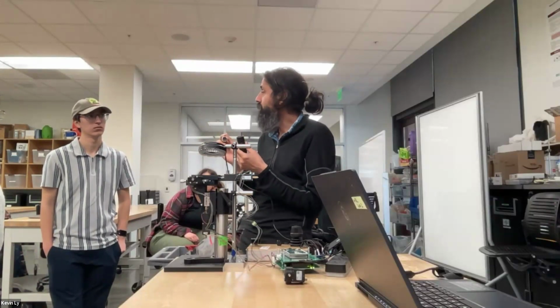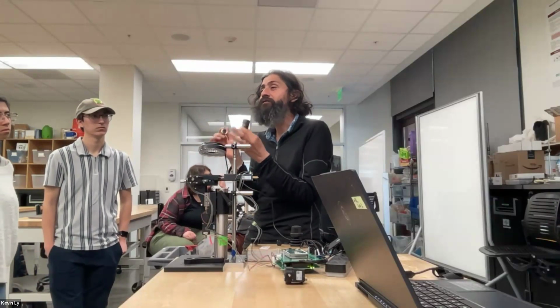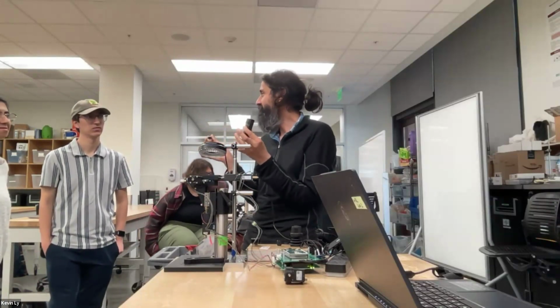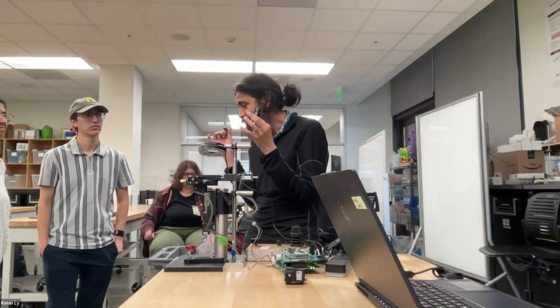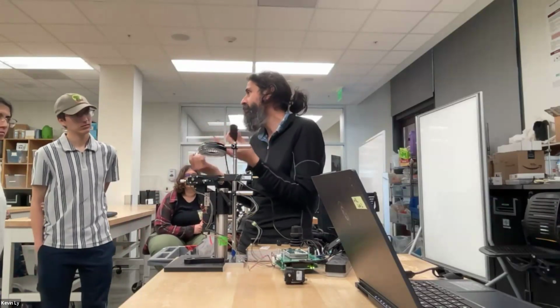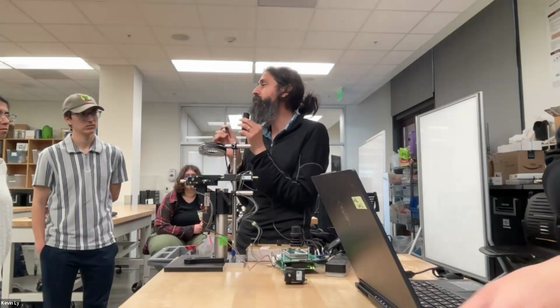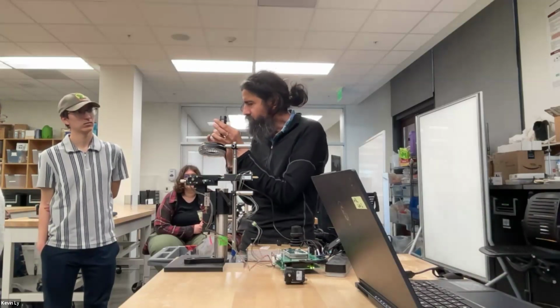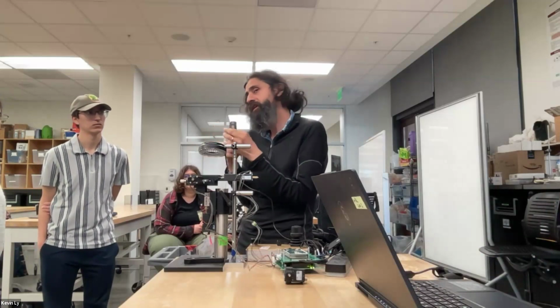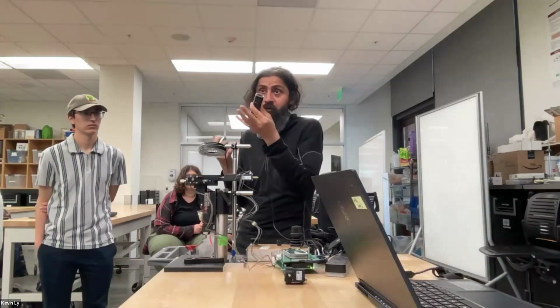It's UV curable. Because you have that moment you've assembled your optical system, and even if you sneeze on it, it's going to go out of alignment. So you freeze it by using a UV curable glue. Norland is this big company. We have that in our machine shop. If any of you is doing very precision assembly, you just align it and flash of light, and in UV it cures. So it freezes in place. So that's the purpose of optical glue.